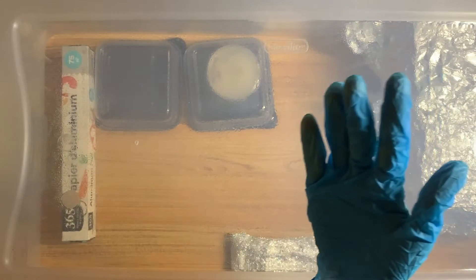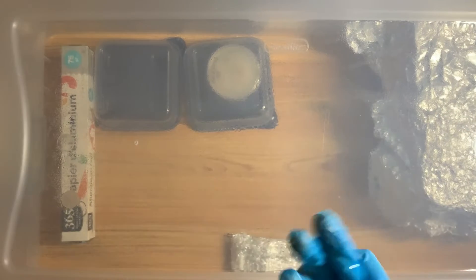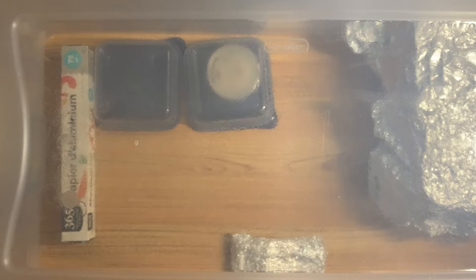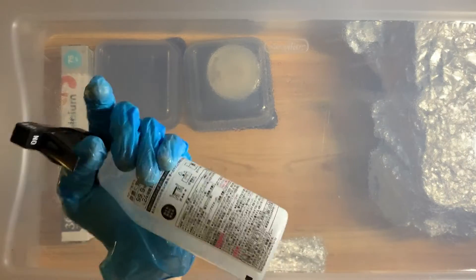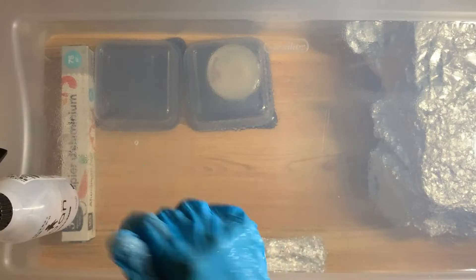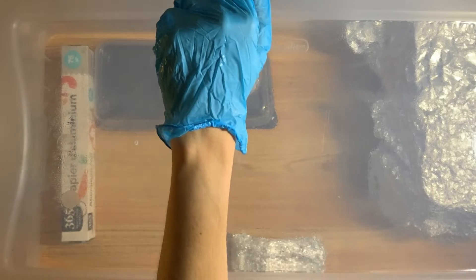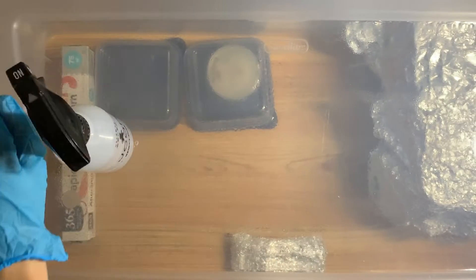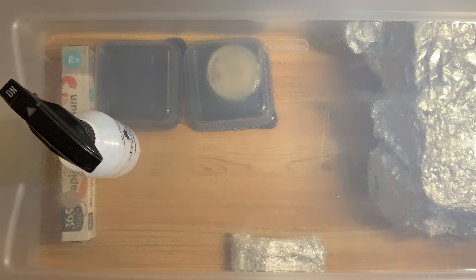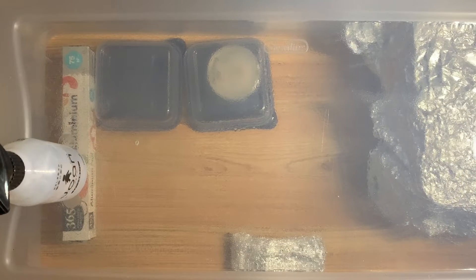Over there, once you spray with the SAB, a lot of water can pool down and you're going to have little puddles of water that could drop down if you mist it too much. That actually happens at the worst possible timing in this video, so take it as a learning experience. It might contaminate that plate, but it is what it is.